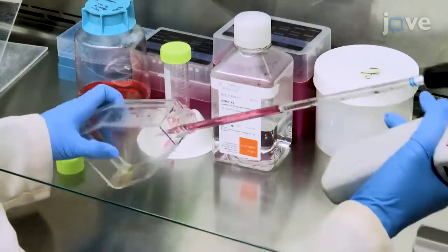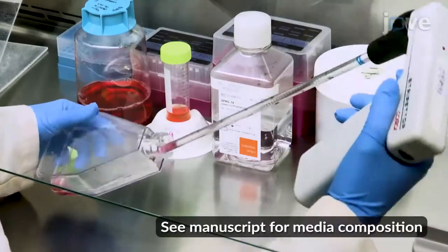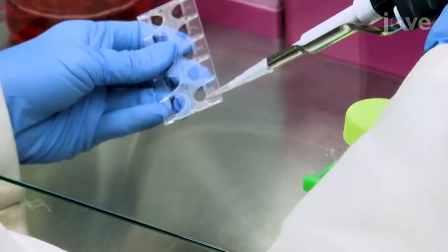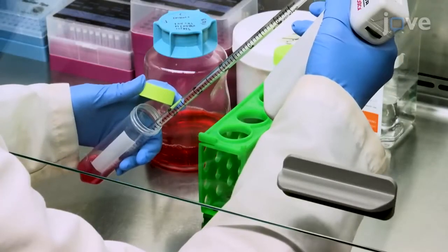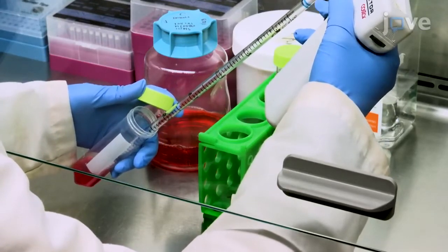Add 4 milliliters of complete DMEM to deactivate the trypsin solution, and then count cells using a cell counting slide and a light microscope. Dilute cells to 500,000 cells per milliliter with complete DMEM.